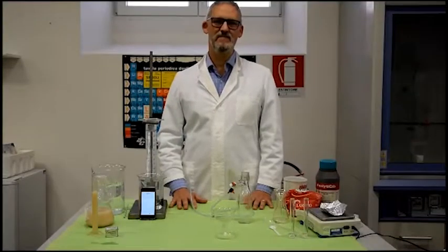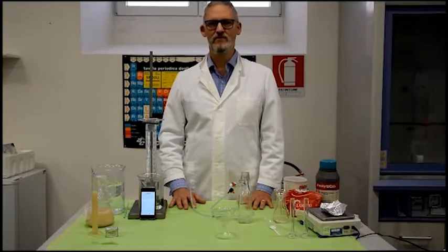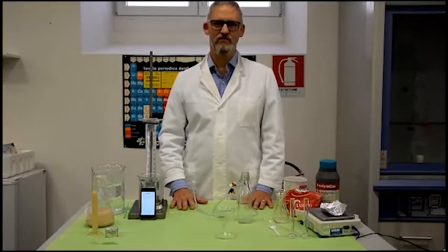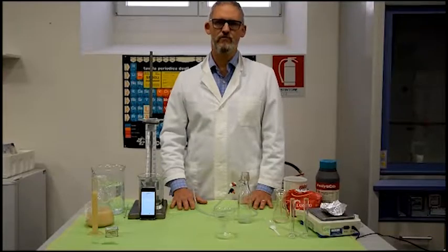Hello, today we're going to demonstrate fermentation using brewer's yeast, which is an important ingredient in most types of bread, when we're making bread, brioches and pizza. The laboratory we're going to demonstrate is the first part of 3 laboratory experiments in which we explore fermentation using yeast. This first laboratory is about getting used to the equipment and the procedures for studying the fermentation process.